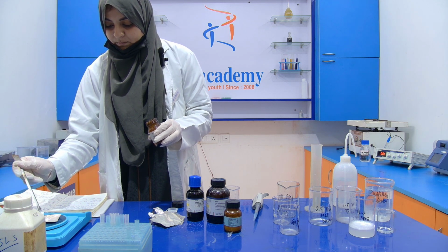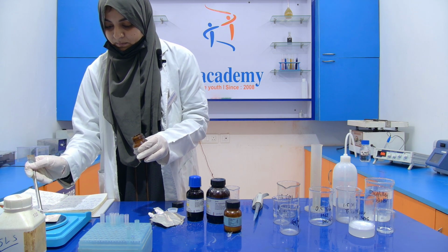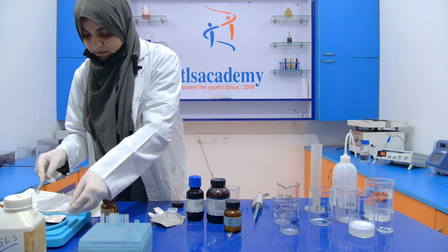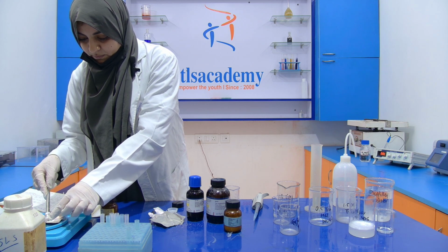0.04. It shows 0.08, so you have to remove some.